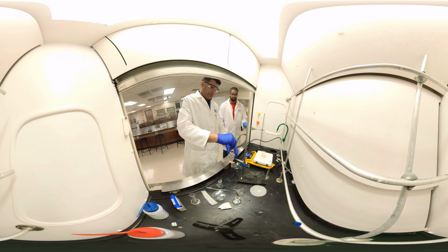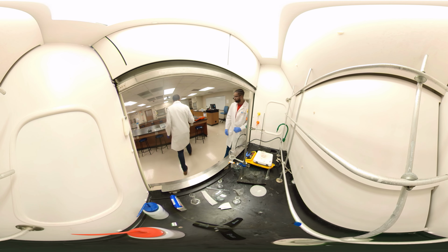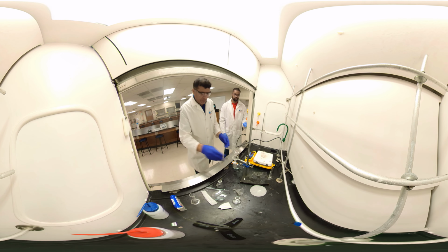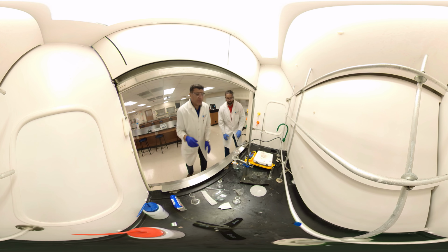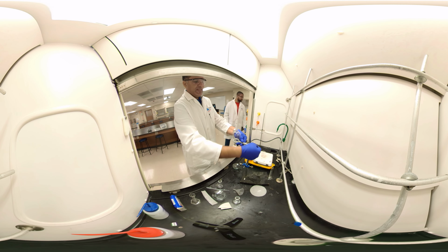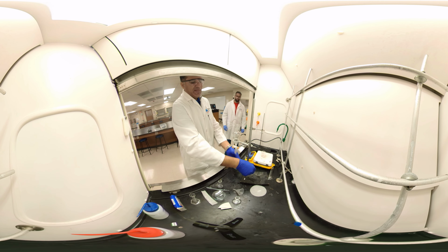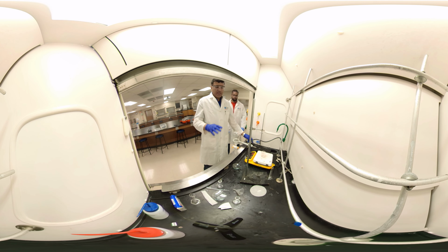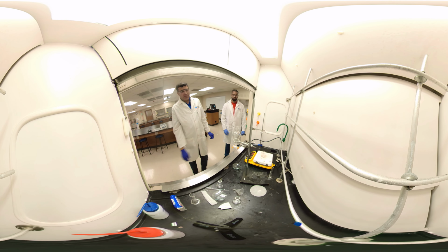Carefully. You take the cap off. While you are draining, the cap must be off. Fine, good. So, I have two layers. I don't know if you can see it clearly from there, but I can see it here. The lower layer is the denser layer, which is dichloromethane. The upper layer is water. So, our aspirin is in the upper layer. The caffeine is with dichloromethane.